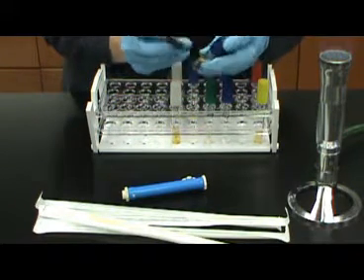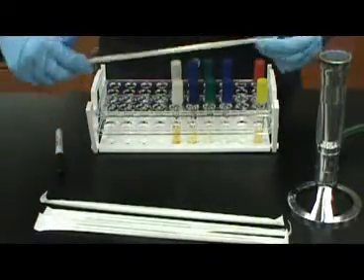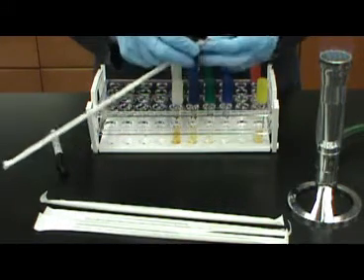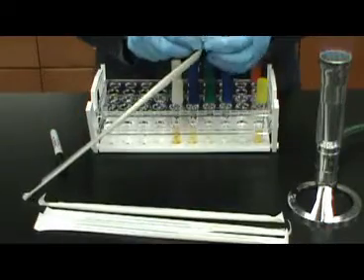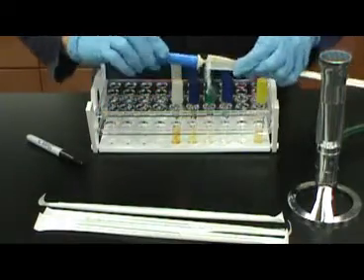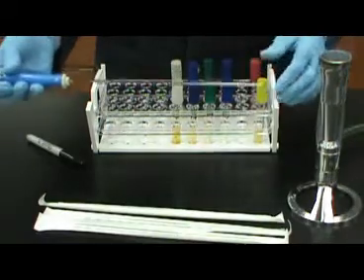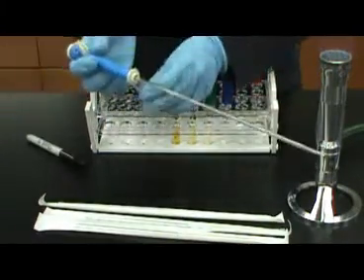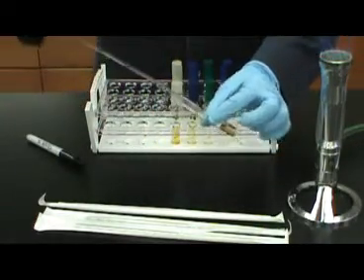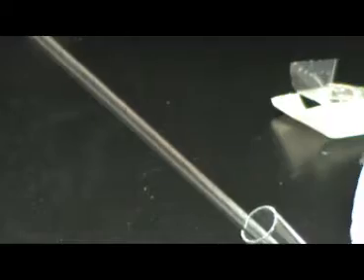Inoculation of each of the media can be done using a serological pipette or a micropipette. Shown first is inoculation with a serological transfer pipette. Each of the tubes will be inoculated with 1/10 of a milliliter of culture. The most efficient way to use the serological pipette for transfer of the bacteria to each of the cultures is to draw approximately 1/2 of a milliliter of culture into the serological pipette. You will then transfer 1/10 of a milliliter into each of the tubes.